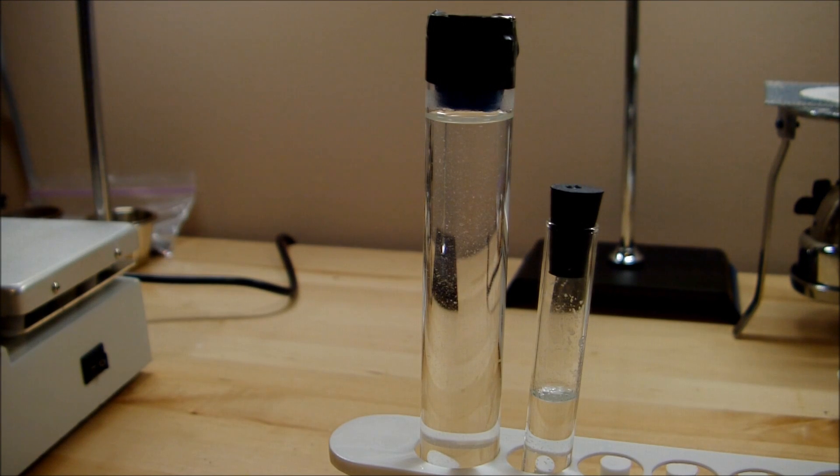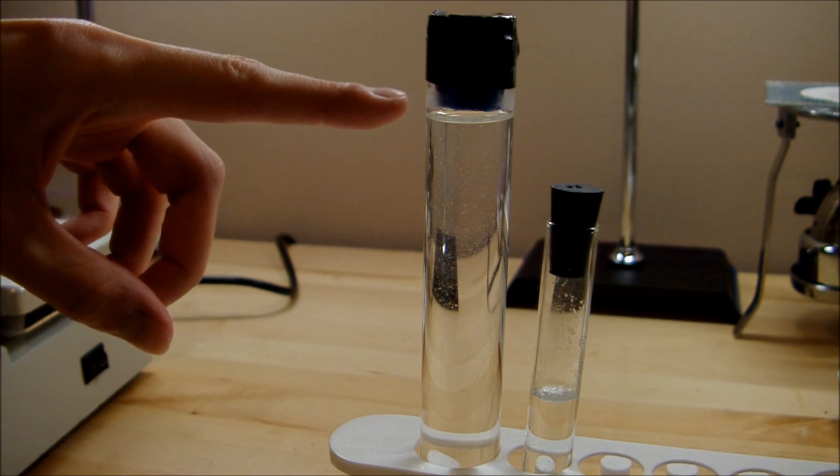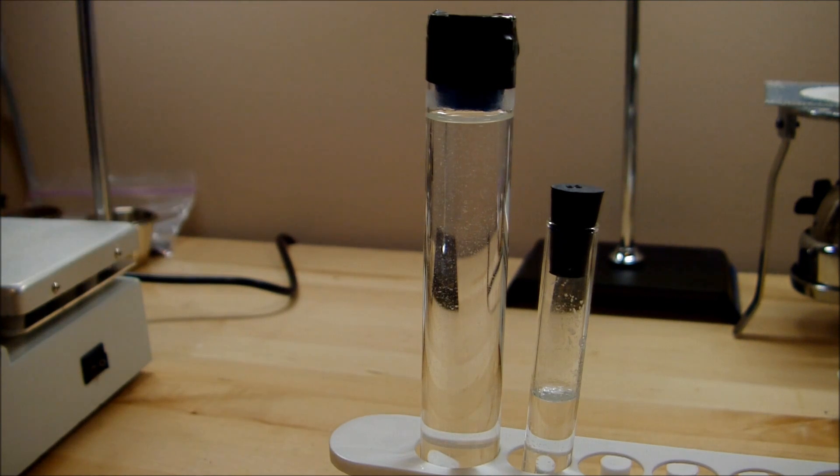I've let everything cool down to room temperature and sealed it up. You can see that I just have the blue stopper in there, and I wrapped some duct tape around it to further seal everything and prevent it from popping off.